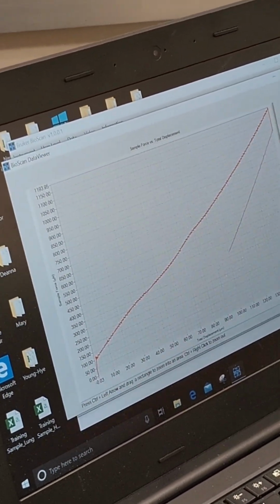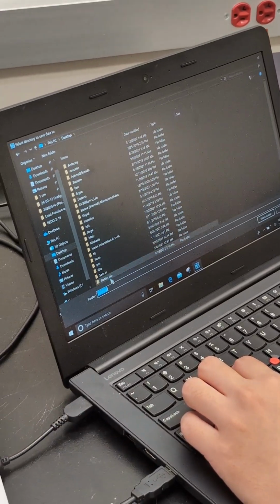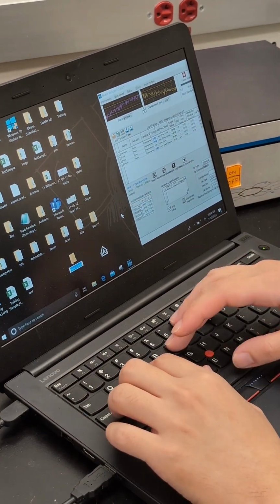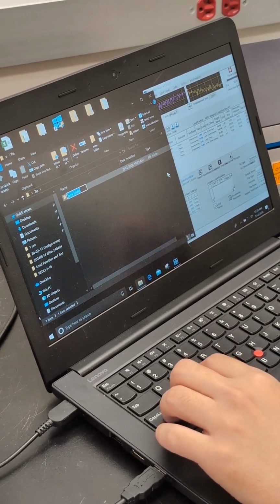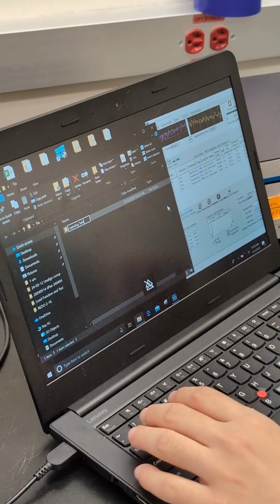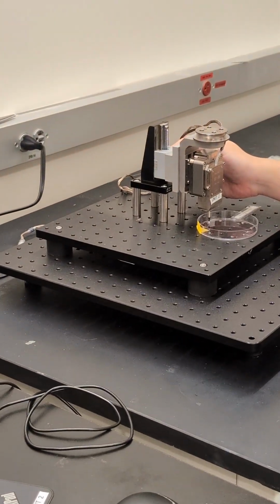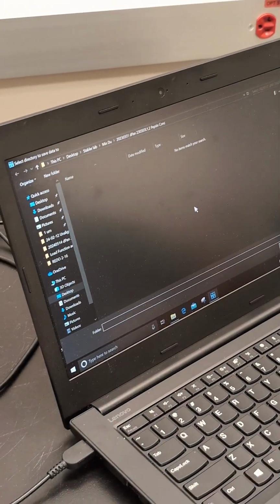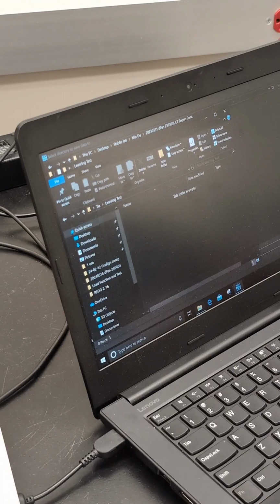Once you have this file, you basically say you want to save it as, let's see, let's just create another file. Just create one here. I hope I saved the other one. This is actually saving under my file. No. So that's today's date. Did it save under this one? Let me see.